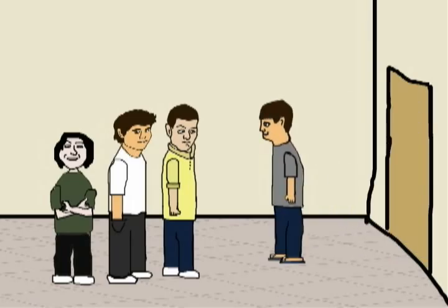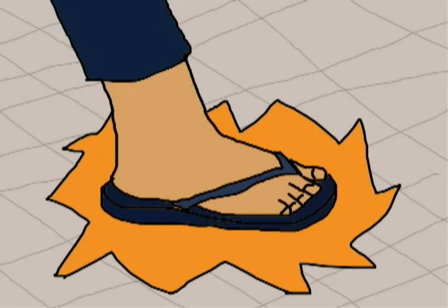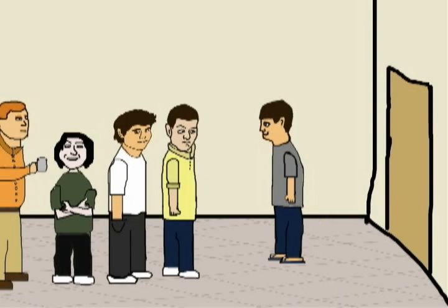Check out my new shoes dudes. What are you guys doing? Showing off my new shoes. I'm sorry, you will not be able to participate in the lab we're doing today without the proper footwear. Please sit in the corner for an hour and a half and do nothing. You're going to have to make up the lab after school. Oh.